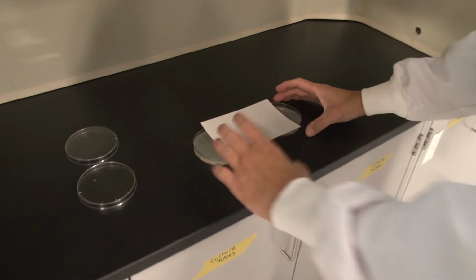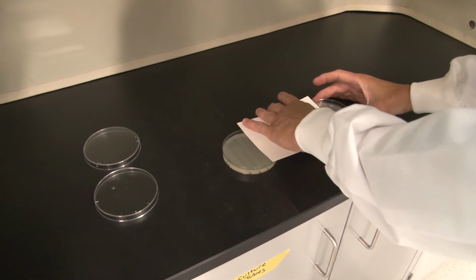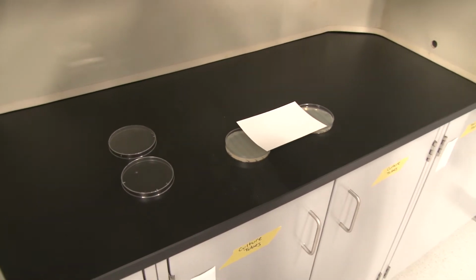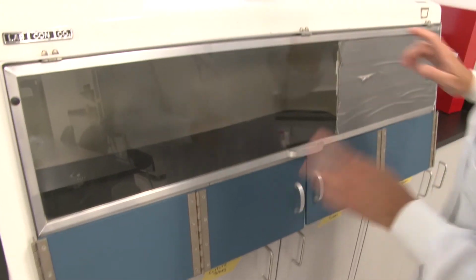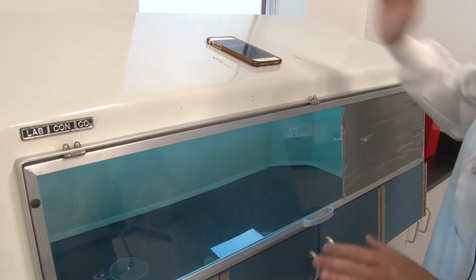We spread our plates apart. Another section exposing the 60, the 30, and the 20. And now, whoops, I close this, reset my timer, and we are going to do this for another 10 seconds. So here we go.